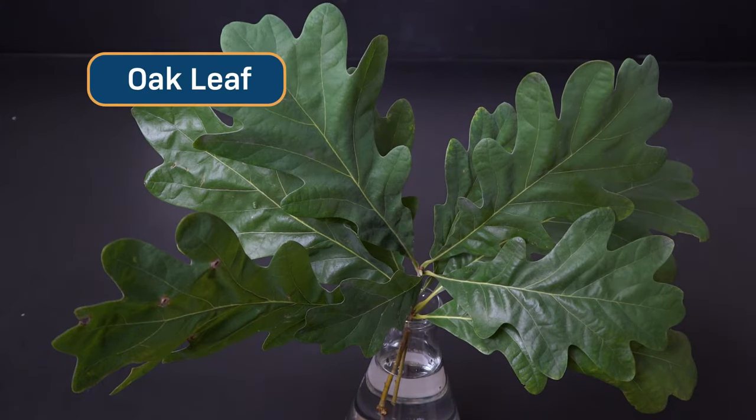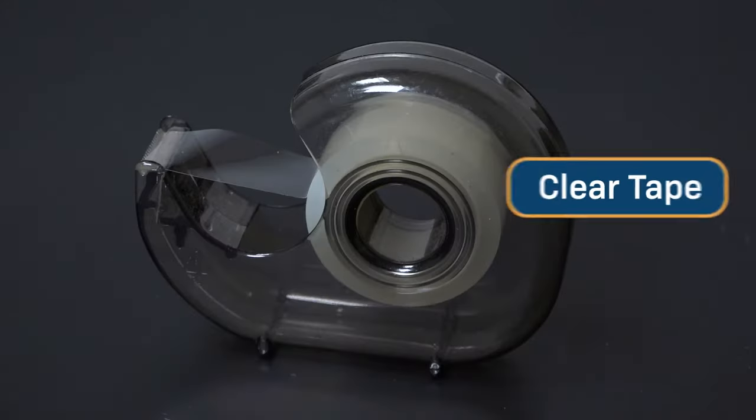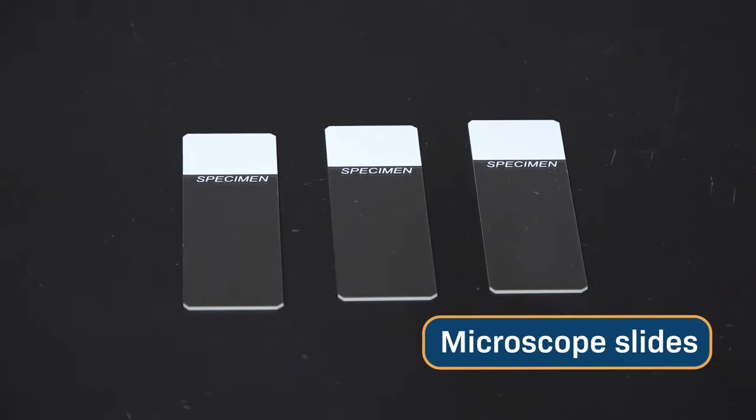All we need are some leaves, I'm using oak leaves today, clear nail polish, clear tape, microscope slides, and a light microscope.